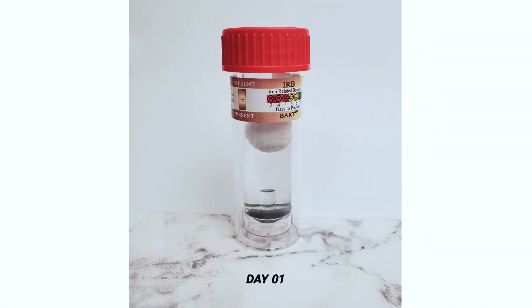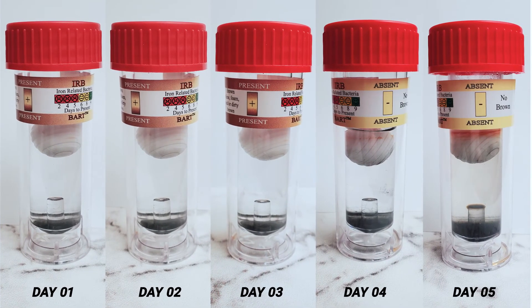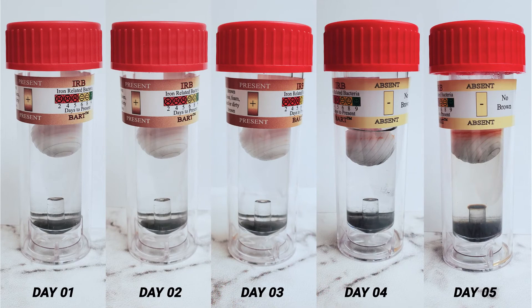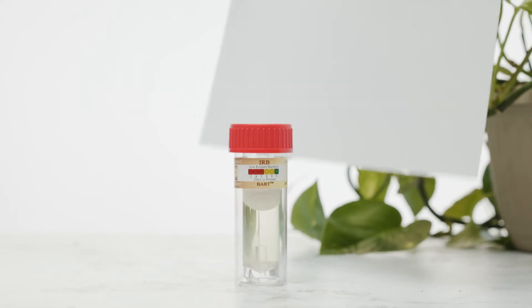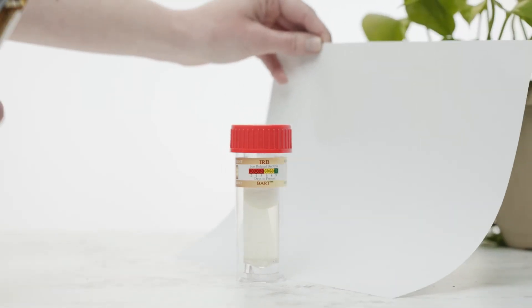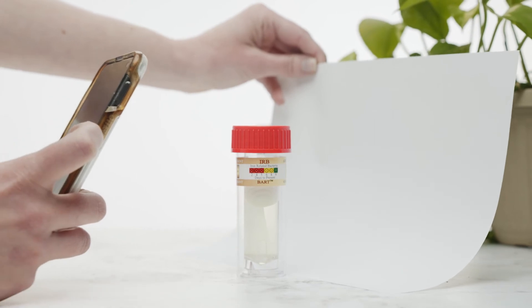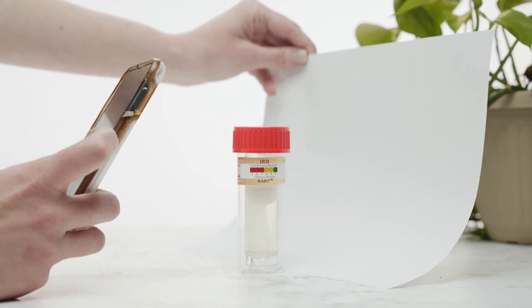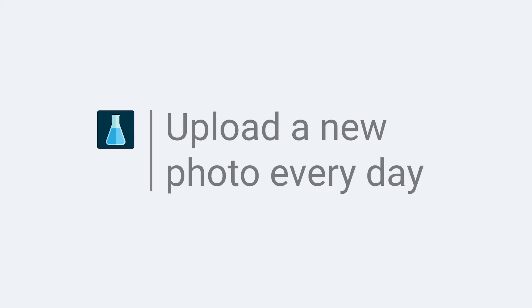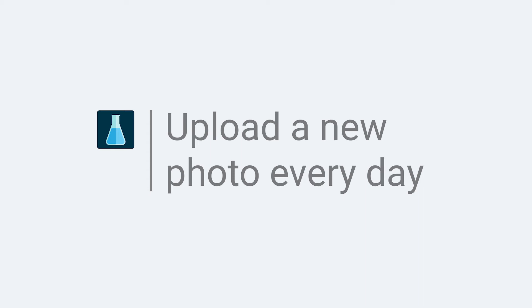Every day, take a photo and upload it to the report. This will allow you to notice small changes over time. For the best possible photo, place the sample on a white sheet of paper and use plenty of soft light. Upload a new photo every day even if you don't see changes.